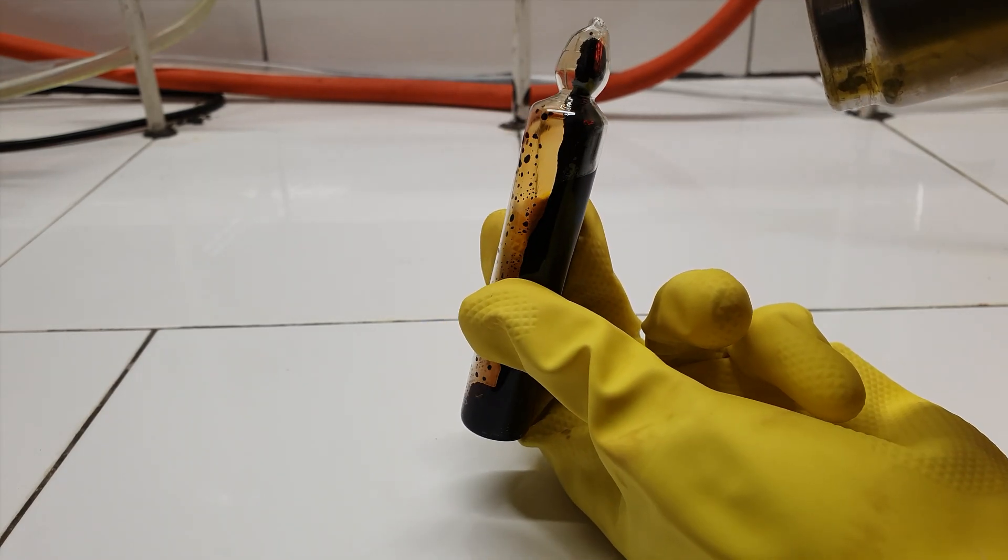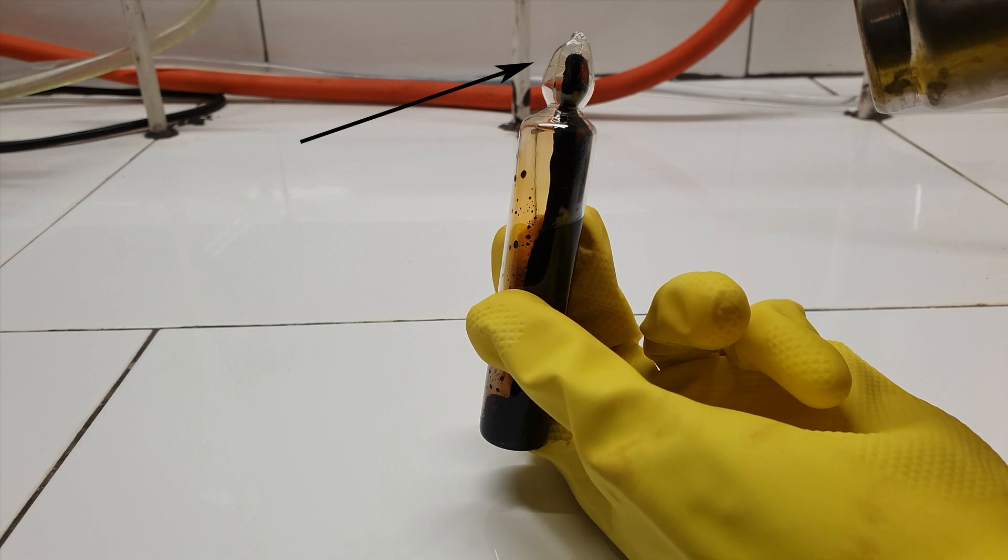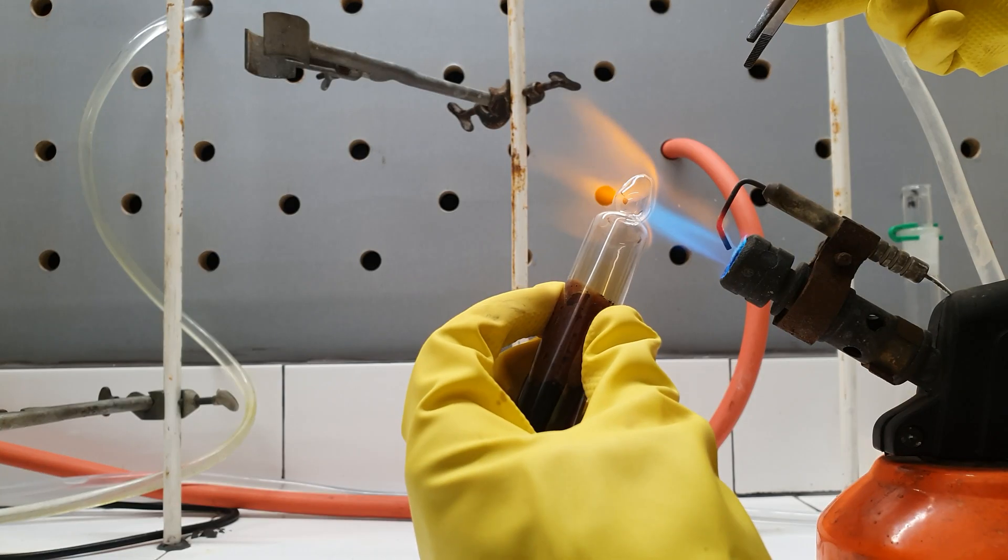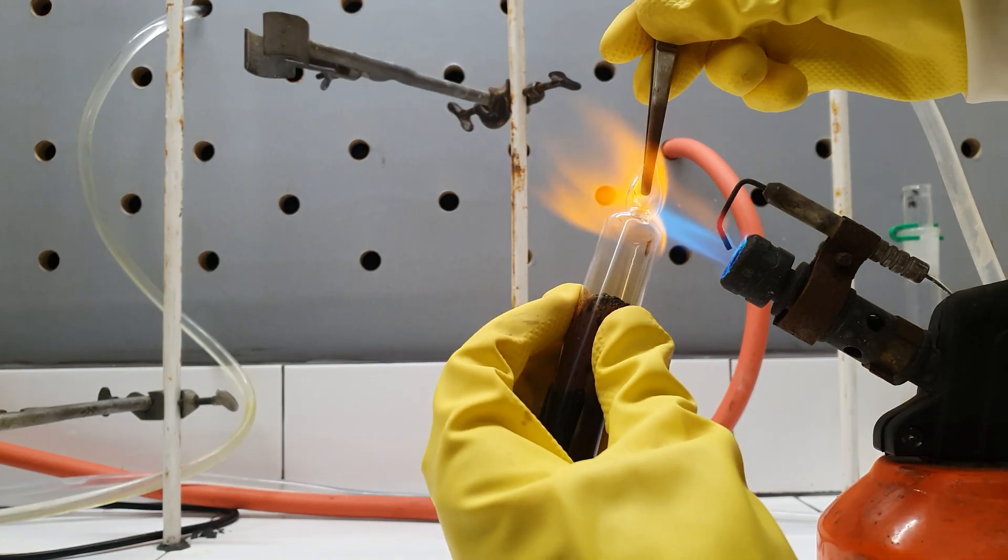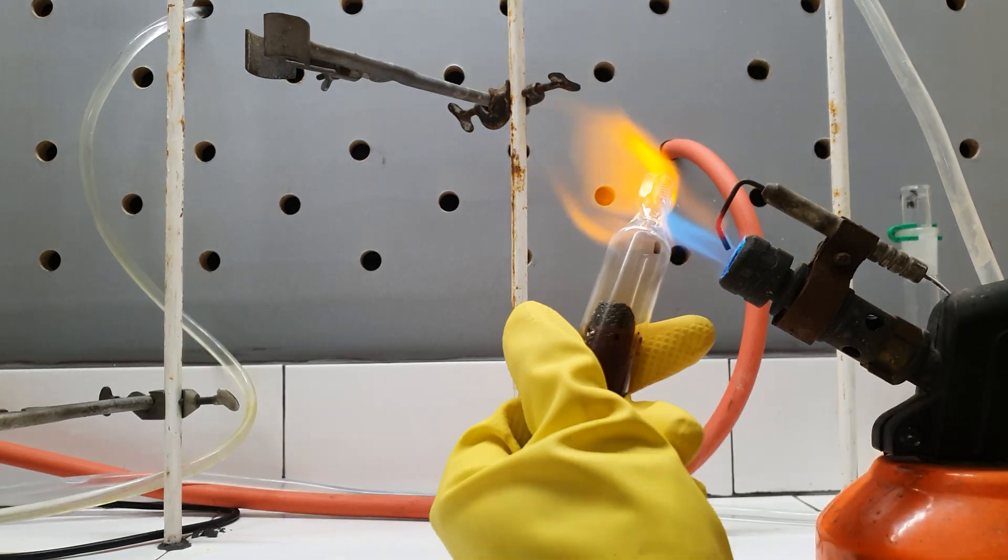When I tried to melt the solid stuff, I accidentally cracked the ampule. Fortunately, the crack was on the top part, so I could easily fix it with my burner.